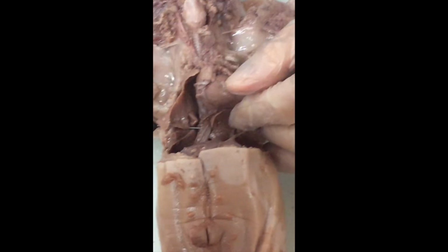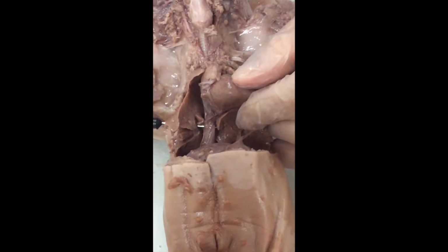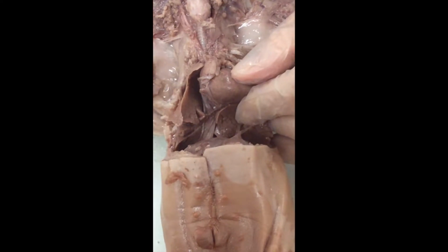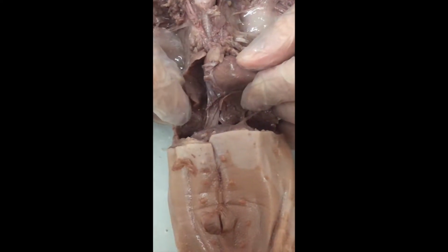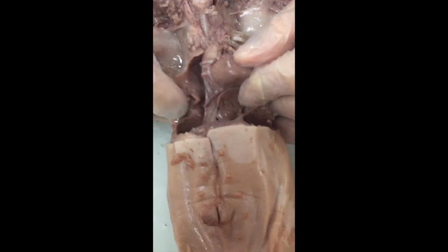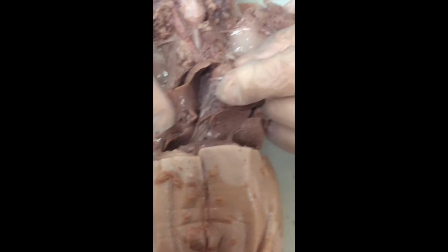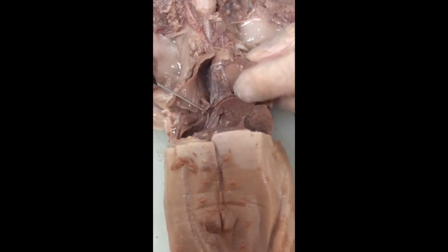Now, we have not yet exposed the stomach. I will in a little bit. But you observe that the esophagus is rather long. It does have to extend all the way through the thoracic cavity. You might think of your own circumstances. Maybe you've swallowed an ice cube and you could feel the coolness move all the way through your chest cavity. So it's a pretty long pipe, and it's got to interface through the lungs and the heart to get through there.